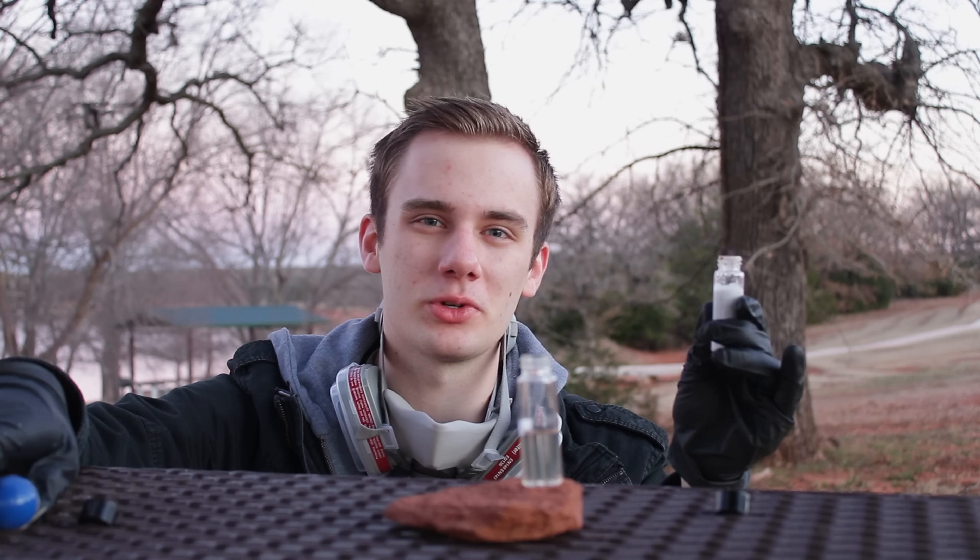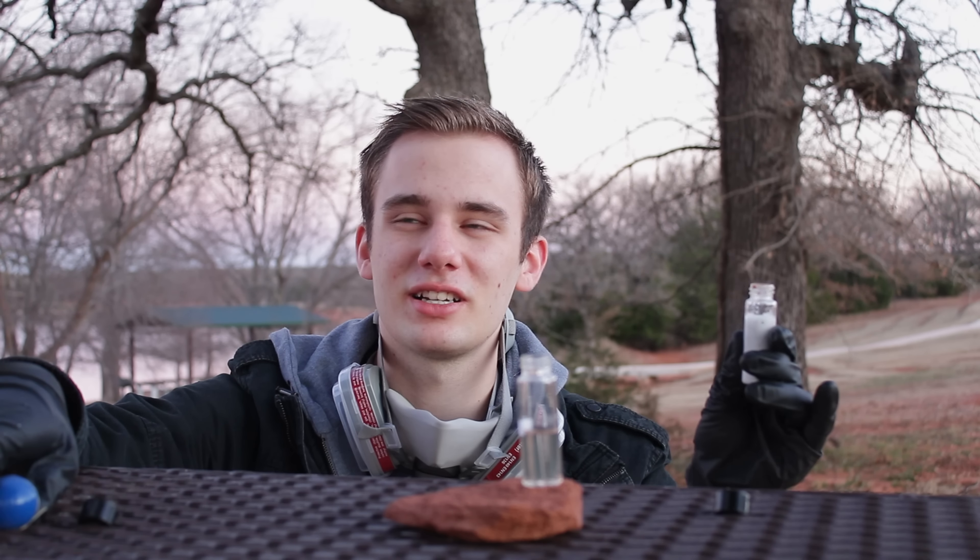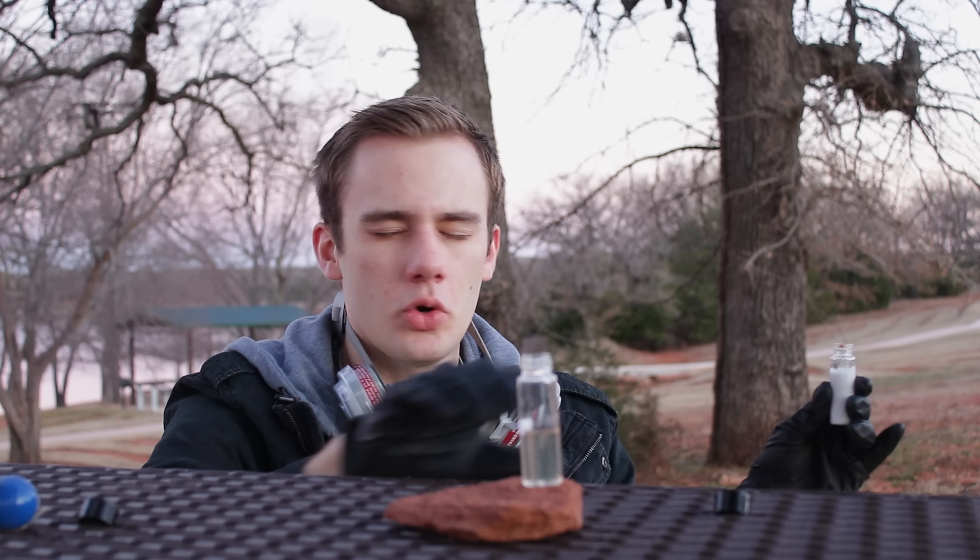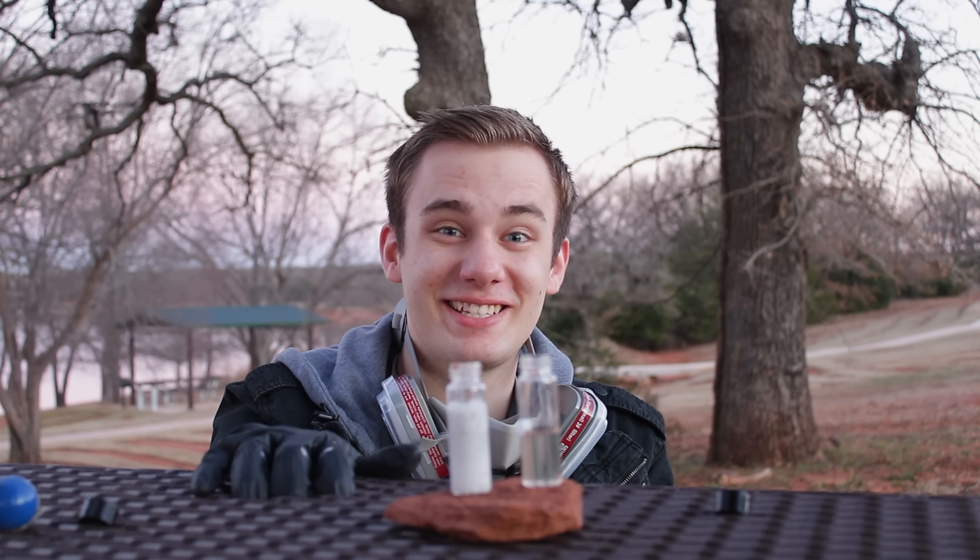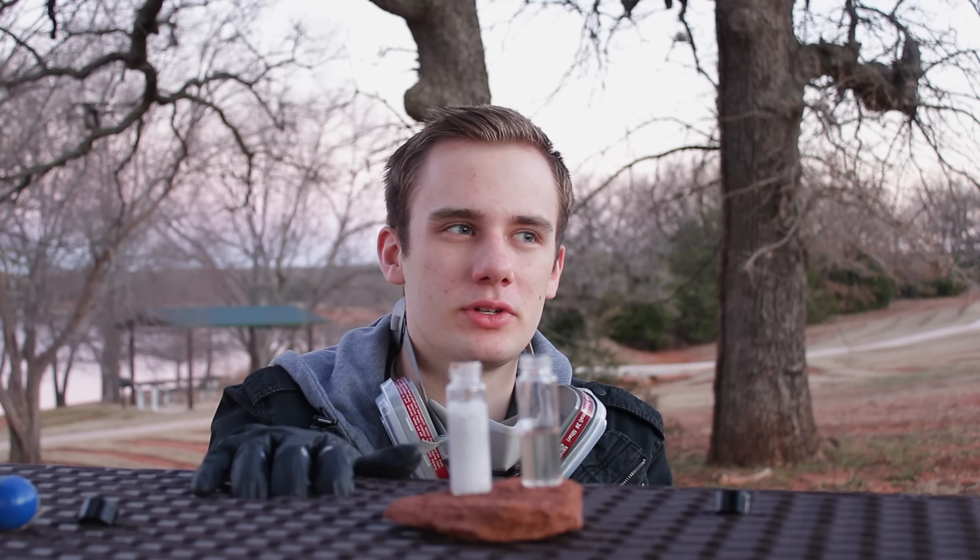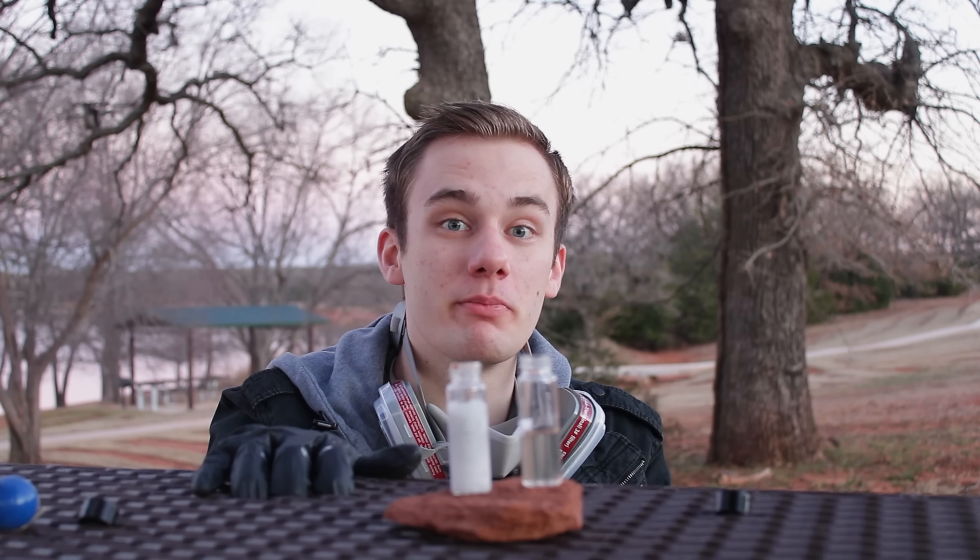That is genuinely one of at least one of the worst smells that I've ever smelled. This is far worse than thioacetone. That one really has the garlicky, kind of, it's kind of garlicky, kind of oniony. But like, it's not as much the smell itself as the actual strength of the smell. You can, it's very, thioacetone was strong. This is, you can taste it. This is remarkably strong. At least up close.